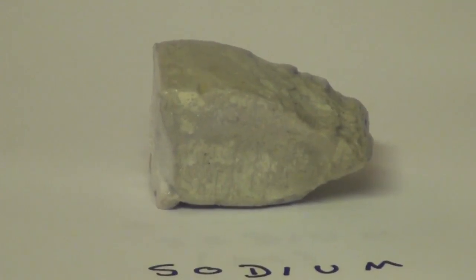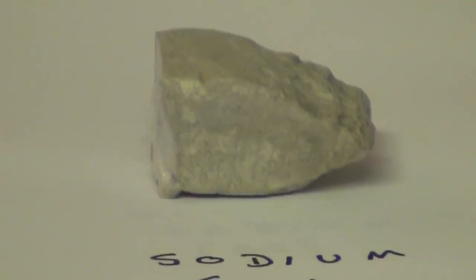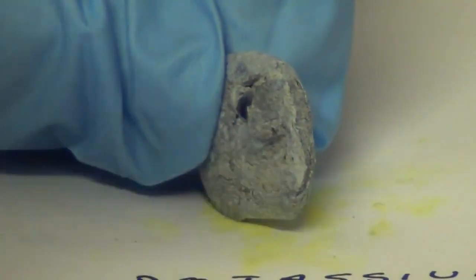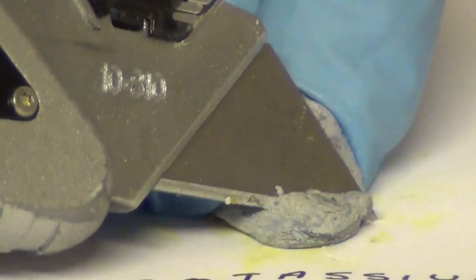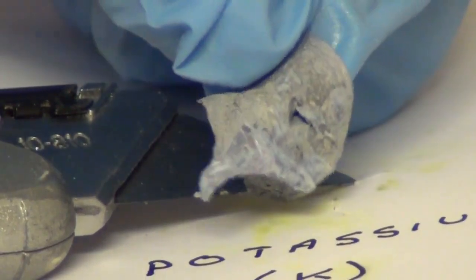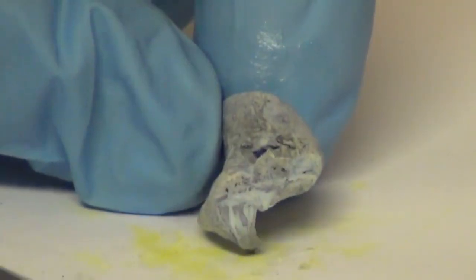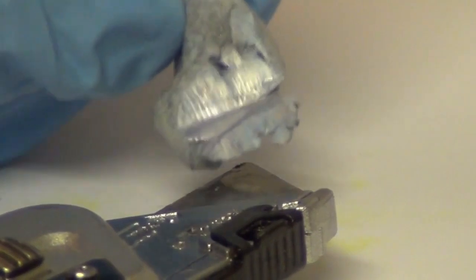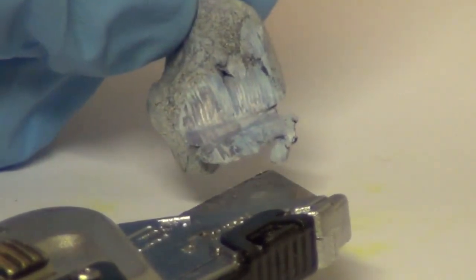Besides sodium, Davy also isolated another very similar metal called potassium. Here we see a piece of potassium. When we cut through potassium, we see that it's even softer than sodium, and it's also more reactive. It's shiny at first on the inside, but within seconds it turns into an oxide and becomes gray. And when you throw it in water, the potassium does react like sodium, but even more violently. Taking a piece of potassium and throwing it in water, it catches on fire, so it's significantly more reactive than sodium.